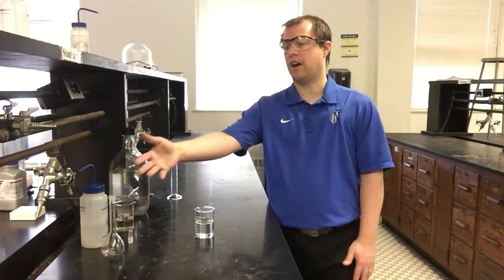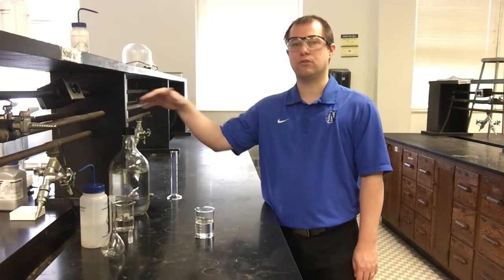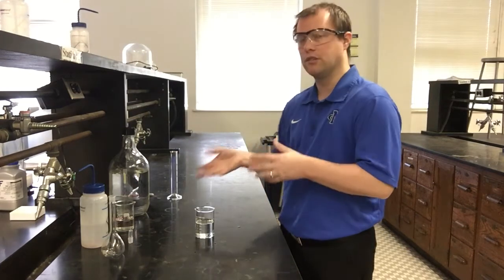That means that if we want a 100 milliliter total volume at the end, that 100 milliliters times that 0.2 molar should be equal to our 1 molar times whatever volume of that starting solution we need to do our dilution. And again, the pre-lab walks you through that calculation to figure out how much of our starting stock solution we're going to need. It turns out we should need about 20 milliliters of our starting stock solution, and then we're going to dilute that to 100 milliliters total, is how that process works.